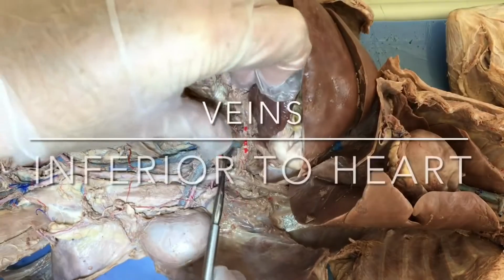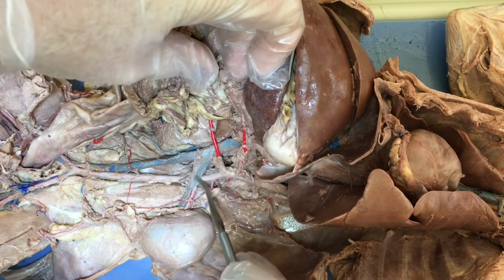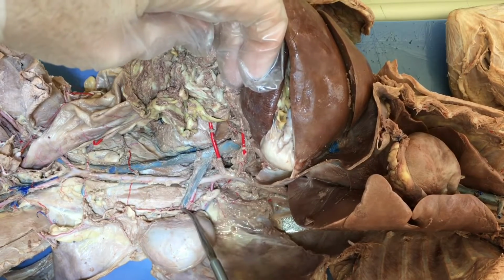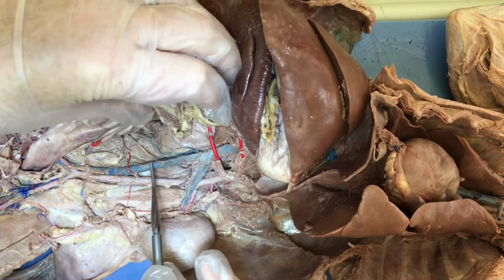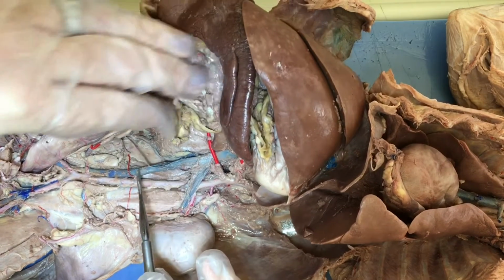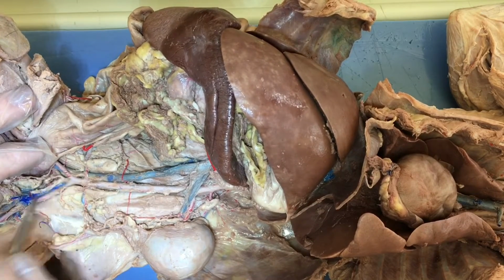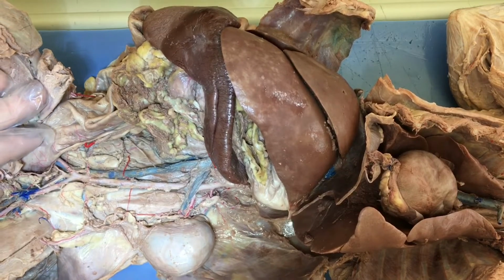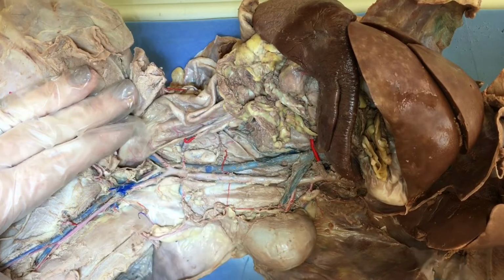Okay, now we're following the inferior vena cava down, and the first branch we see here is the renal vein. It's the one that brings the blood from the kidney. And then we follow the inferior vena cava down even further, and then you're going to see it branches right here into the legs.